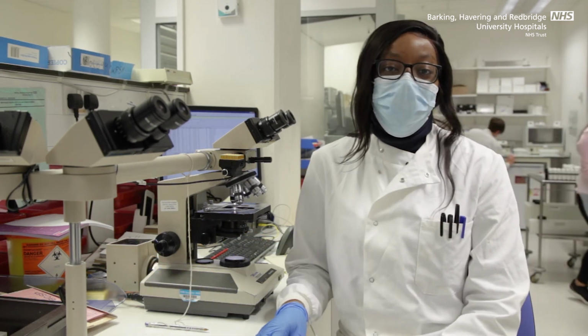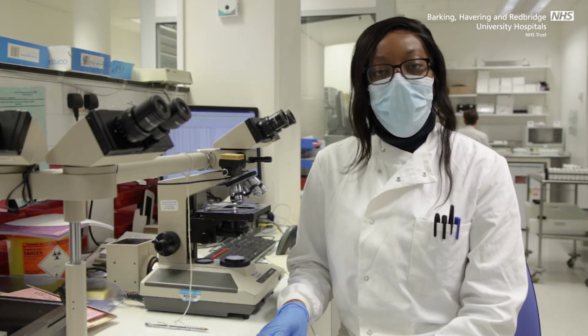This marks the end of a specimen's journey through histology. We hope you enjoyed the tour.